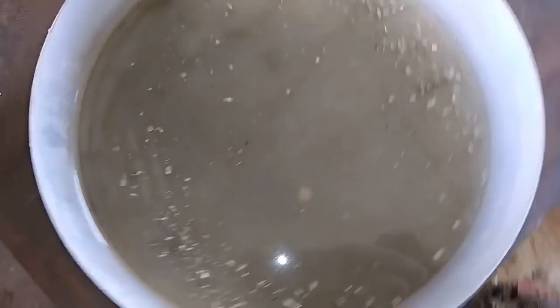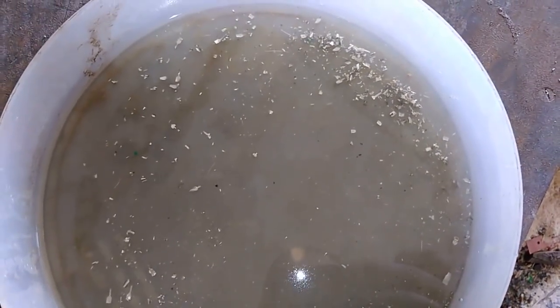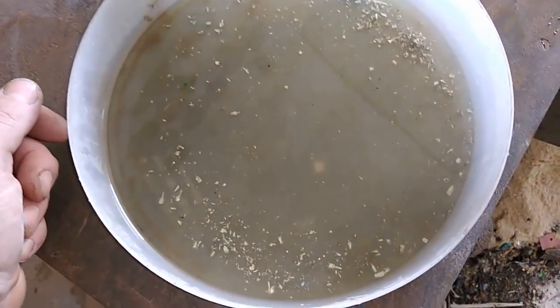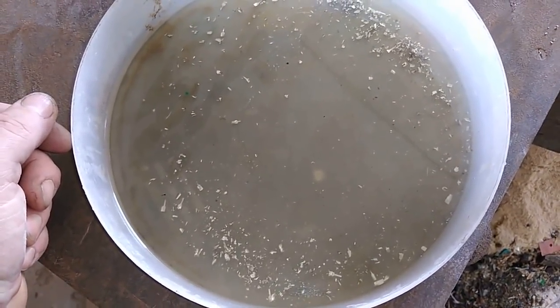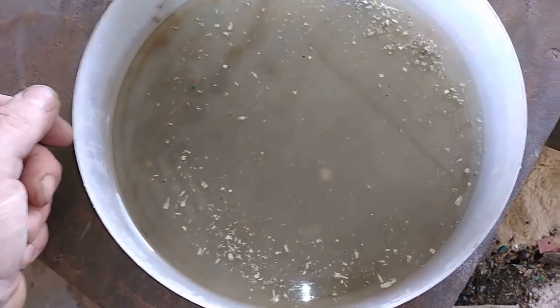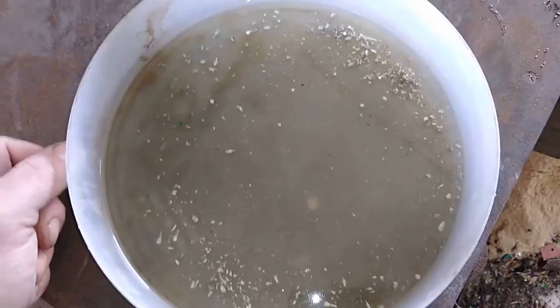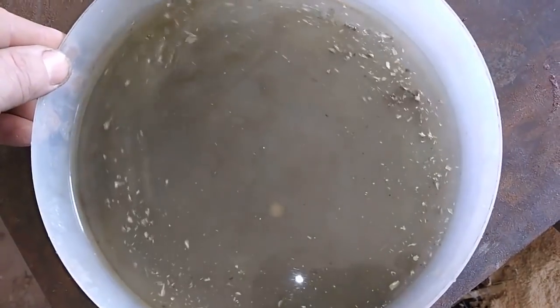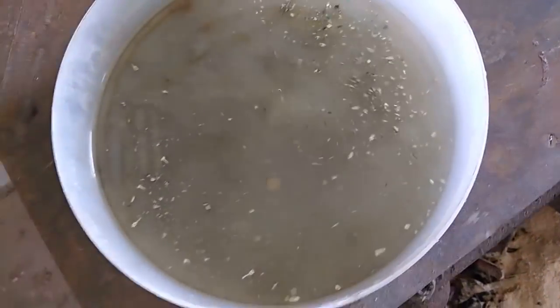I think the best thing to do is to refine that or just melt that. What I'm going to do — it's not too much there, definitely — but what I'm going to do is dissolve that and drop it with aluminum, then melt it. It's much easier to melt that than these foils. So first let's filter that.